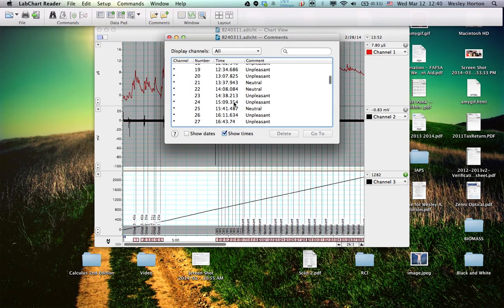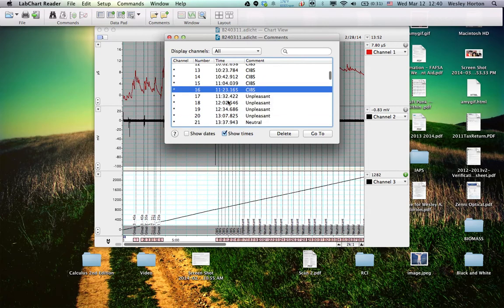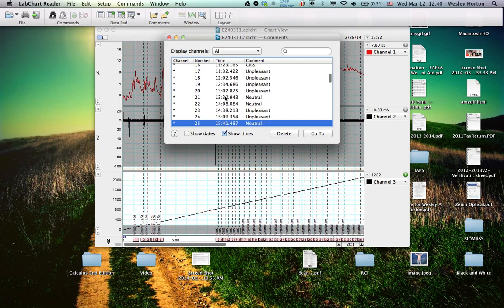And let's go ahead and count things. So we should have 8 of these. 1, 2, 3, 4, 5, 6, 7, 8. Actually, I think that's 9. Anyways, but we're going to definitely have 30 of these. So 1, 2, 3, up to 30. Yep, that's correct. We're going to have 8 or 9 of those.